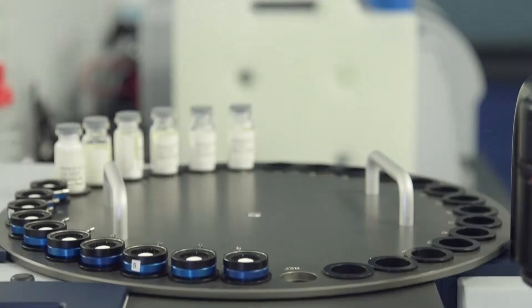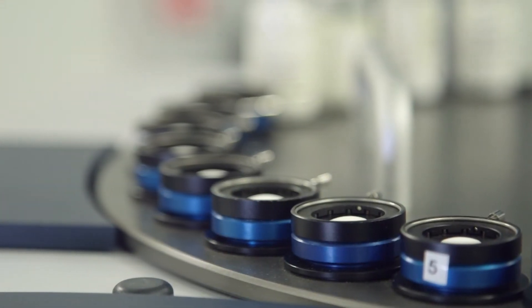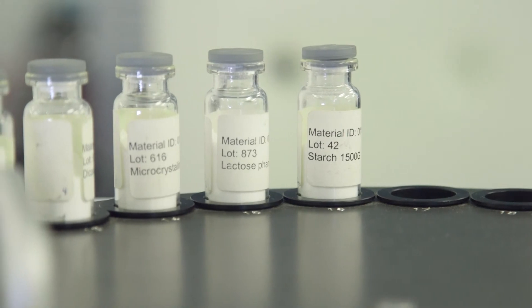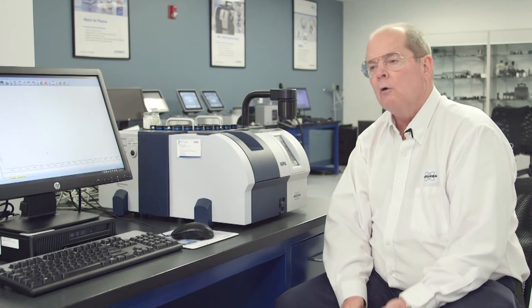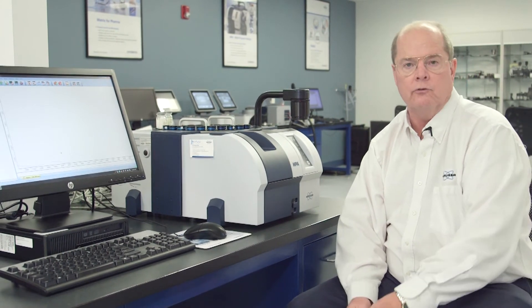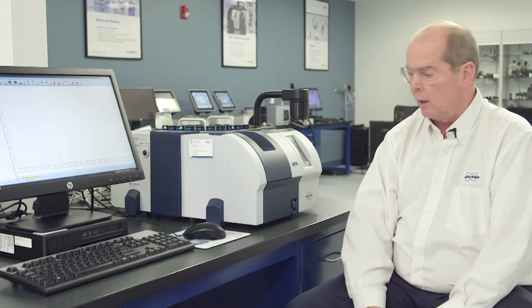We have an integrating sphere, which is useful for doing reflectance measurements on tablets or for doing reflectance measurements on powders, for raw material identification, for blend homogeneity analysis, granulation, drying applications — a multitude of applications for powders.